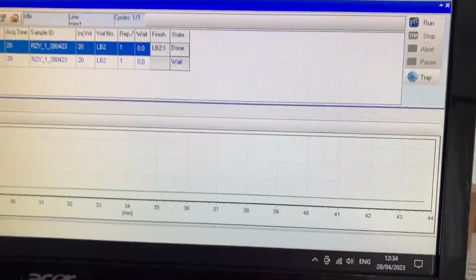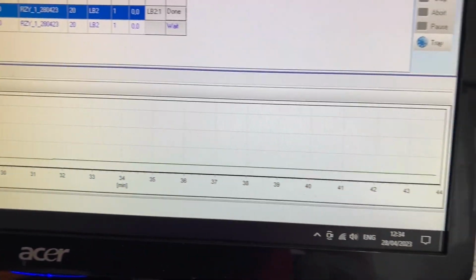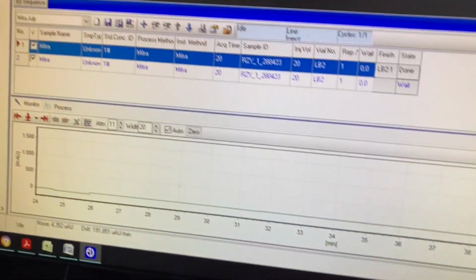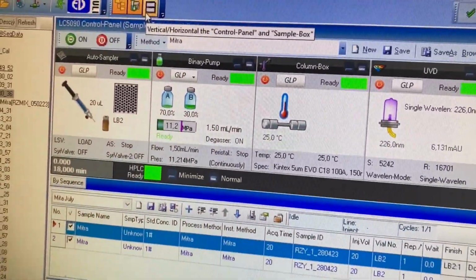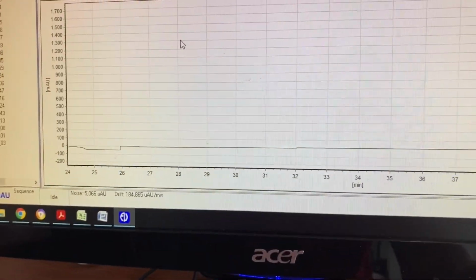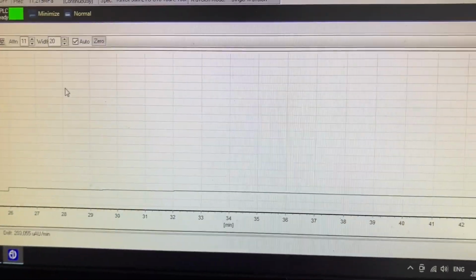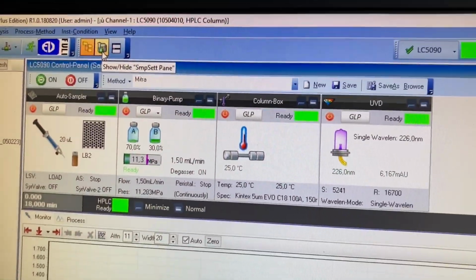Yeah, it's all running nice and stable. It's a nice stable line, and to show the sequence, just to get rid of it, to increase the size of the graph, you just click on that one there.